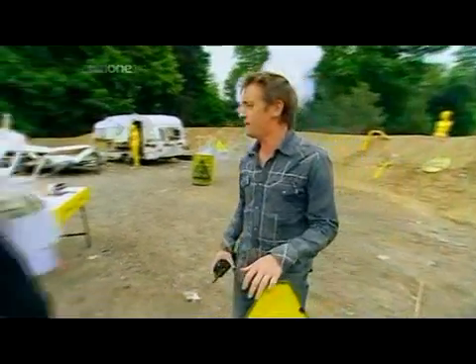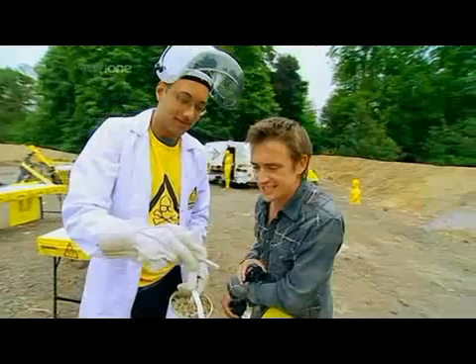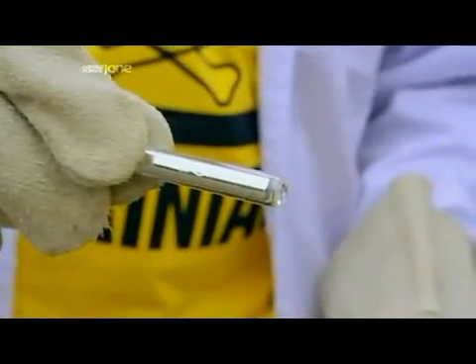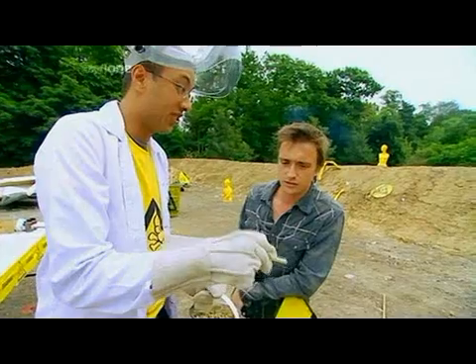Mr. Tickle, bring on the rubidium. Here it is. Is that it? Well, it might not look like much, Richard, but it's a highly reactive metal. It's sealed in this glass tube under argon atmosphere conditions, just for safety.